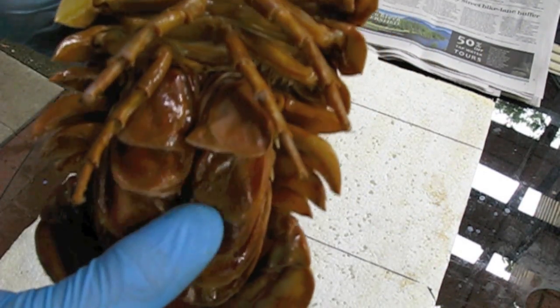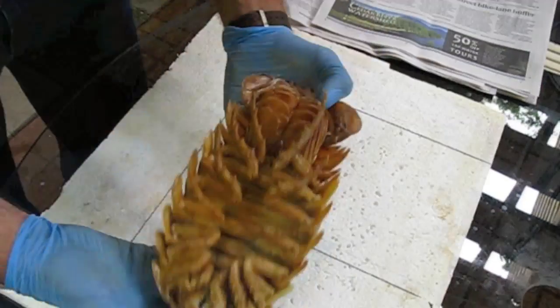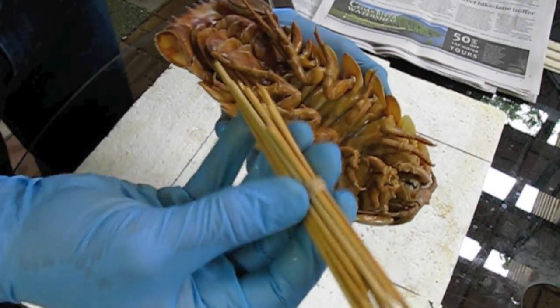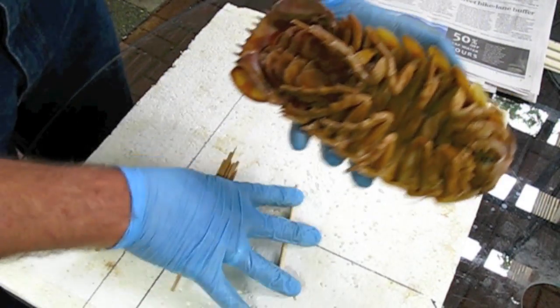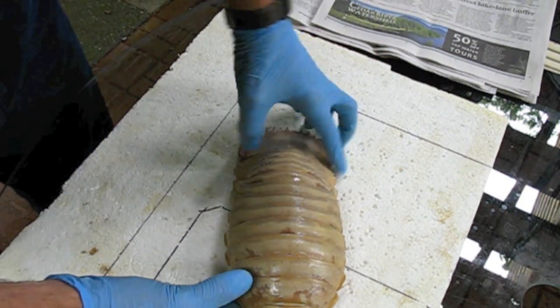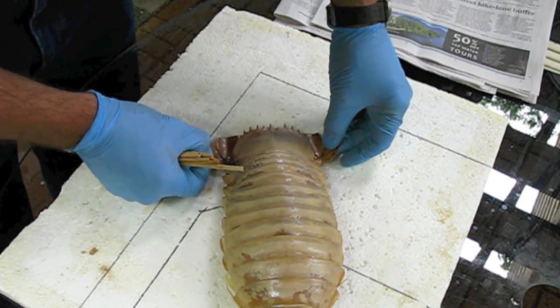And then these are the gills underneath — gas exchange. What I'm going to do is use these bamboo skewers — I've got some bigger ones too — to use like pins, and position it on this styrofoam, and let it dry so that it looks natural, like it's alive.